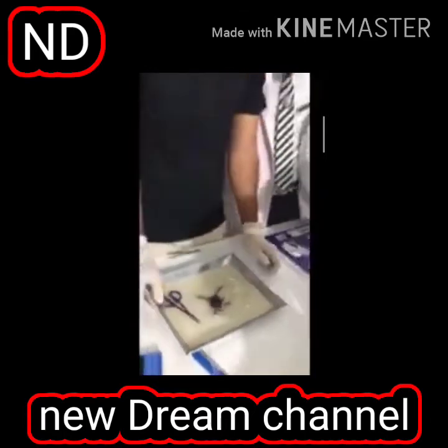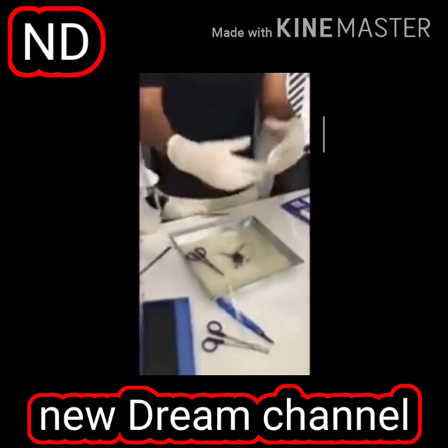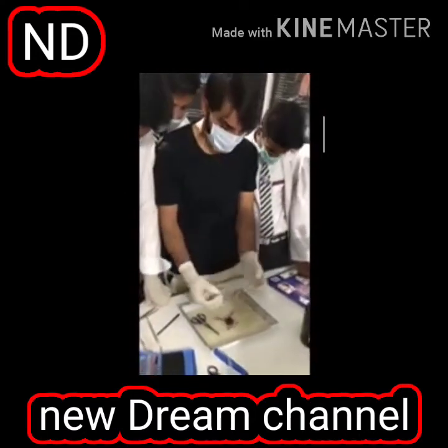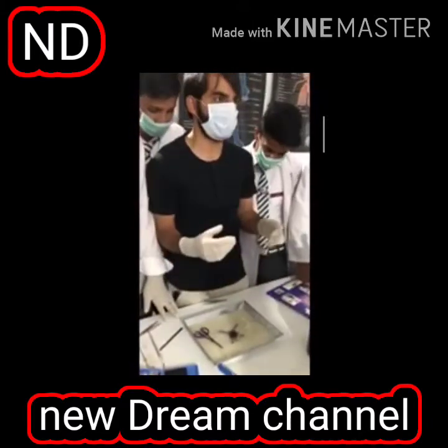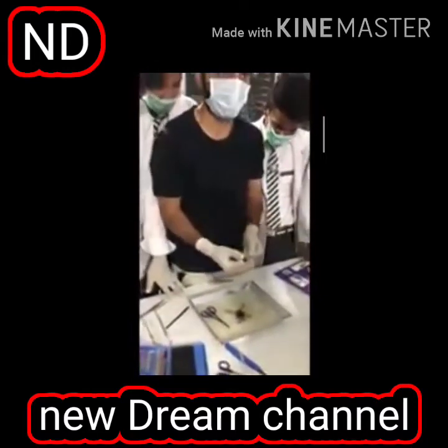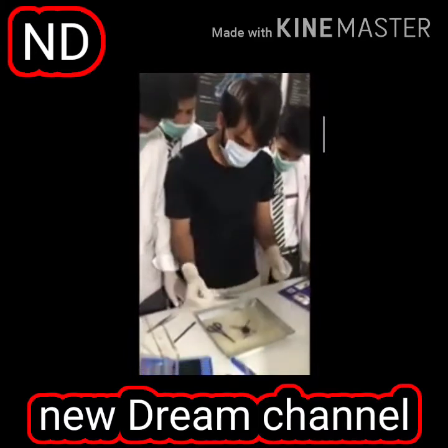Now you see here the first step of dissection in frog, that is we just cut it, we take its skin away, and we can see its heart, we can see its digestive tract, we can see intestines, इसके बाद intestines होते, we can see stomach, हम इसे stomach देख सकते हैं, we can see its buccal cavity as well.